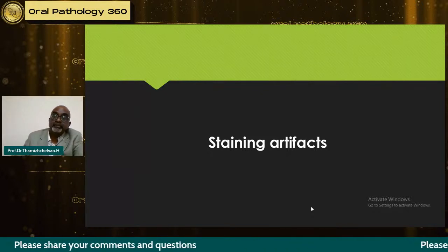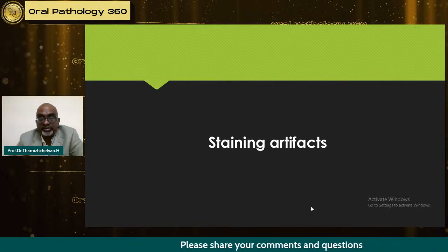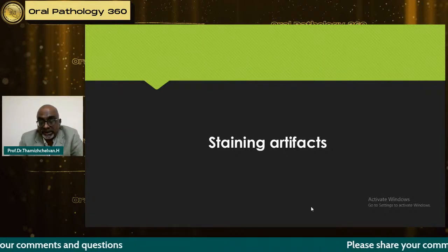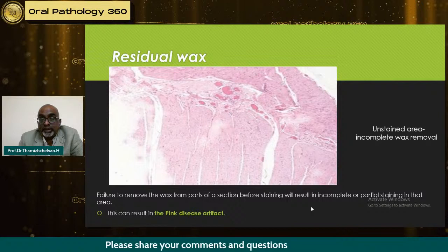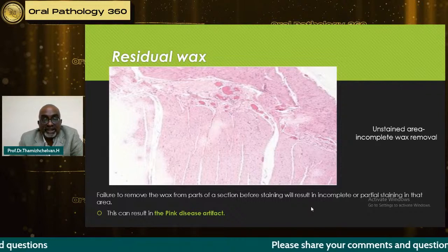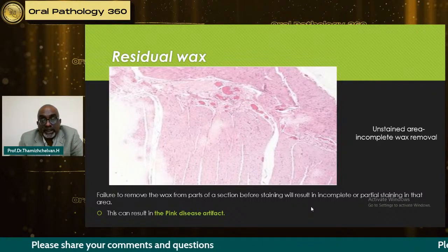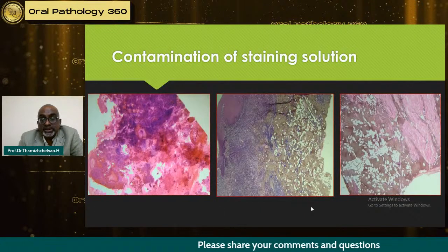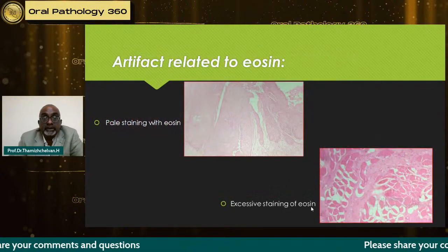Now comes a major problem, staining artifacts. The technician gets time to go out, and she or he wants to finish before leaving, so as to hand over the specimens to the PGs so that they can take them to the pathologist. Here the problem takes place. When the wax is not properly removed, you have an incomplete wax area. If incomplete wax is still remaining there, you have an unstained area. This takes place because of wax being left, and can give a problem like pink disease artifact. And because of contaminated solutions which are not properly maintained, these are the pictures you get on the slide.